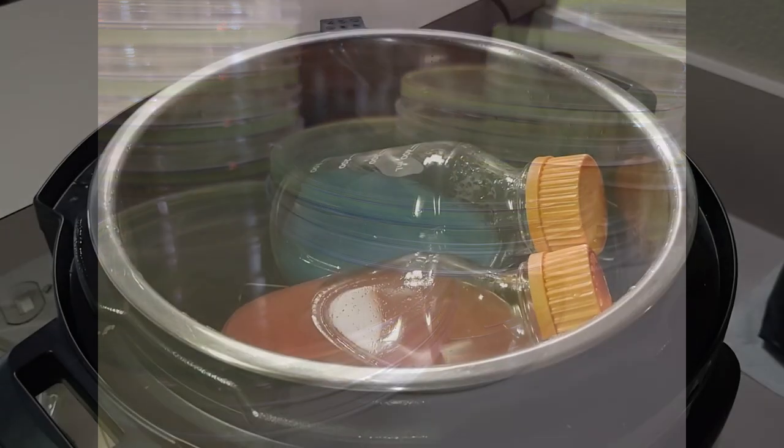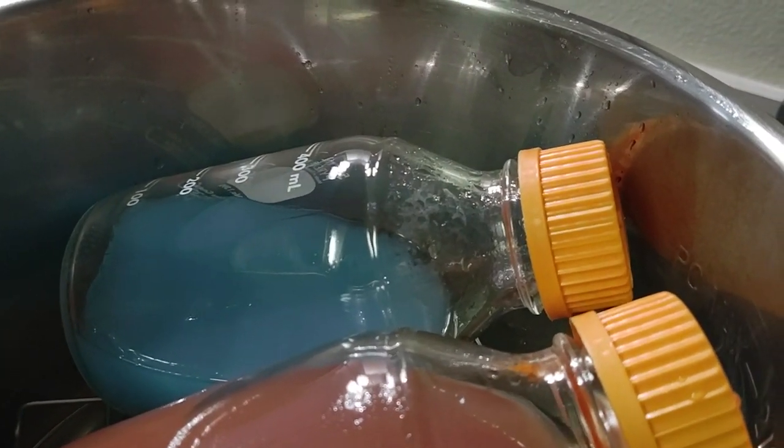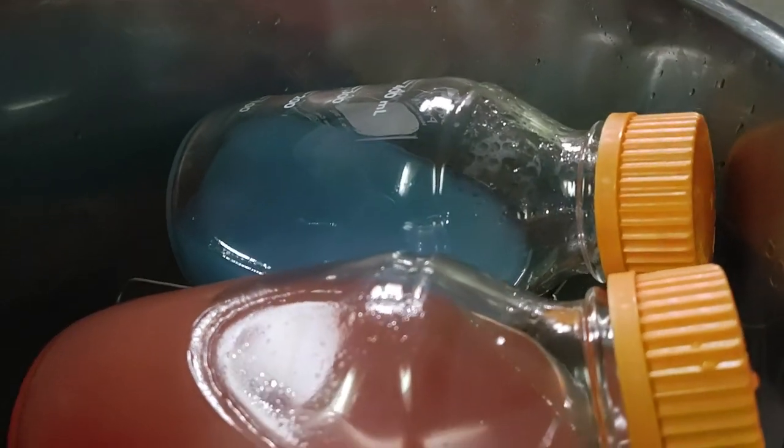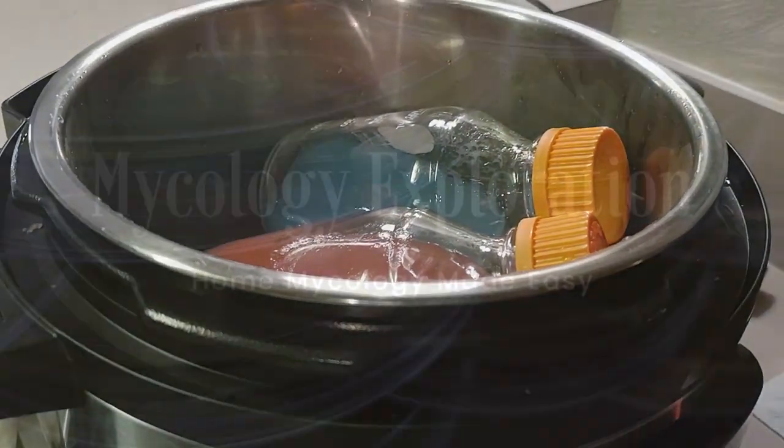We recently had a comment asking about the temperature of your agar before you actually pour it. And we have found that between 120 to 140 degrees, it's just the perfect cooling temperature to start pouring.